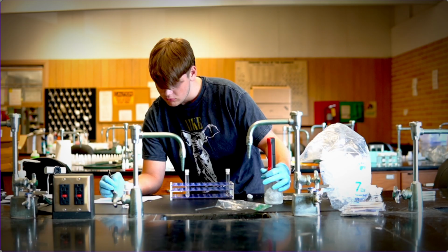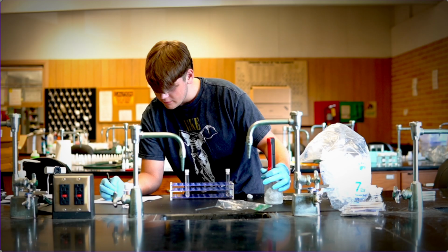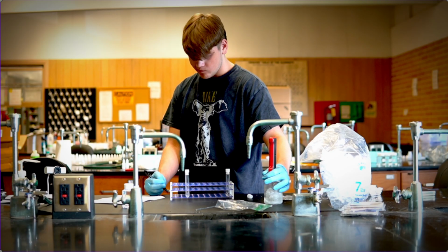So keep an eye on it, because it might freeze. You might not believe me, but it can freeze. It might not freeze in pure ice, but it will freeze in ice that has salt in it, right? So you record the data into, guess what? This table, right? So the second one is 30 grams of salt. You measure the ice temperature before, ice temperature after. Then you measure the temperature inside the tube over time.